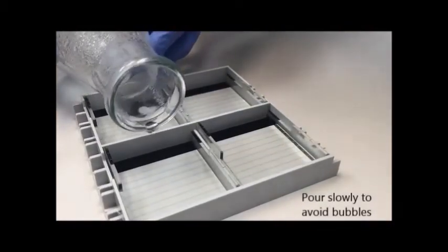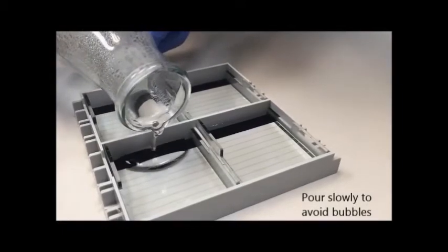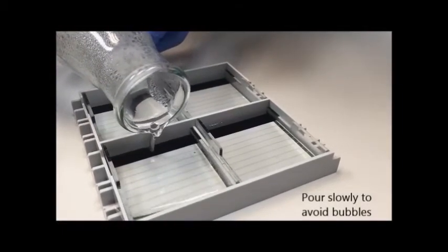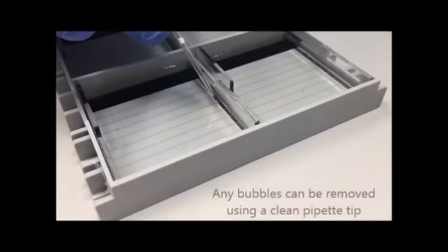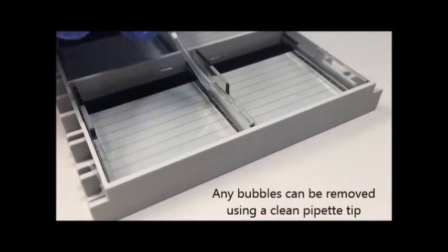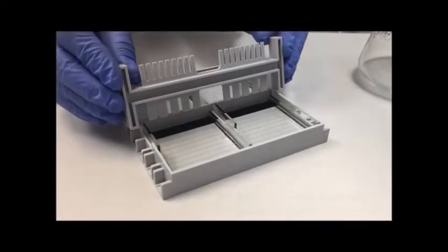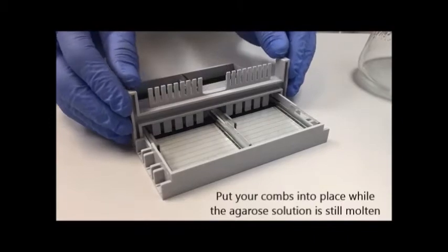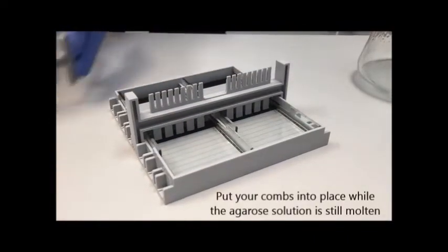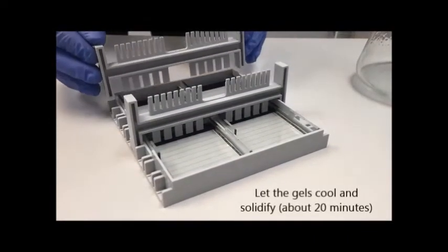Pour carefully and try to prevent any bubbles forming inside the gels. Any bubbles that do form can be removed quickly with a pipette tip. Now put your combs into place and let the gel cool for about 20 minutes.